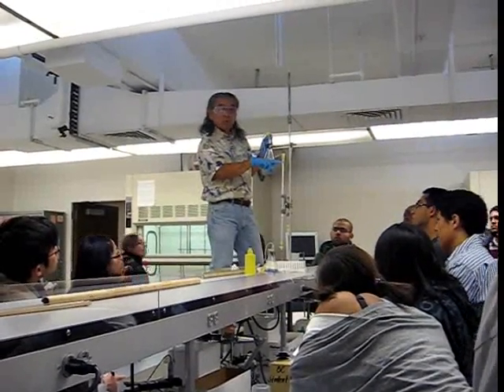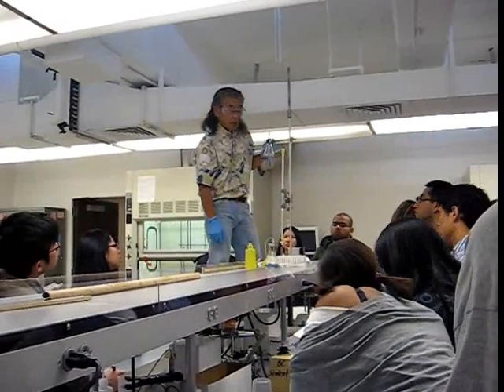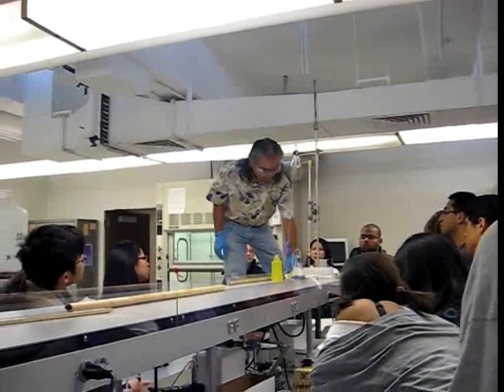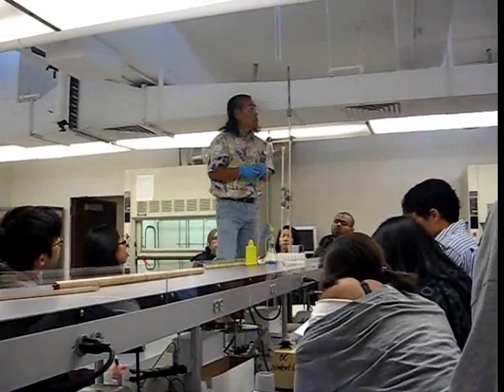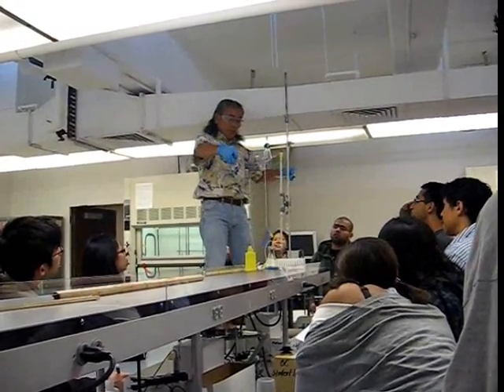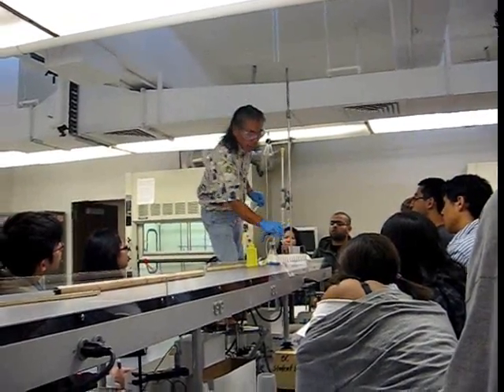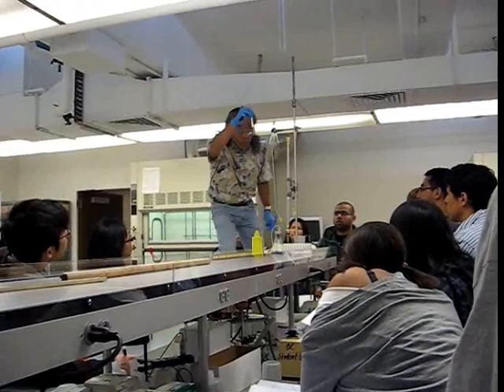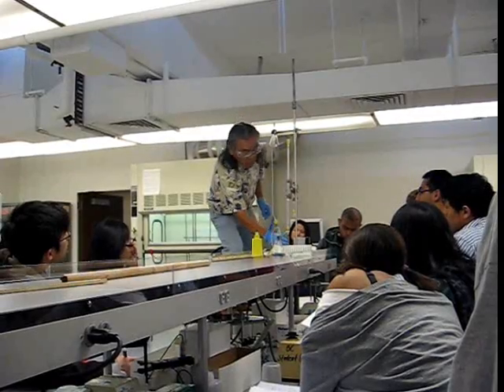After you've added your sample, you're going to start collecting 1 ml. We're in the process of equalizing at 15 ml. At that time, you'll take your test tubes — mark them 1 ml — and line them up on your bench in a straight edge. Mark a set so that you will have 1 ml that you can see. You should not have it where you cannot see where that level is when you're collecting.